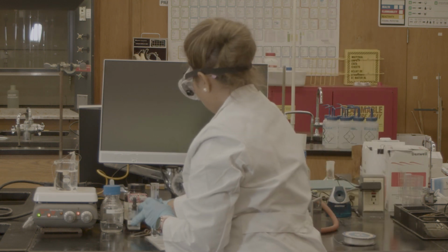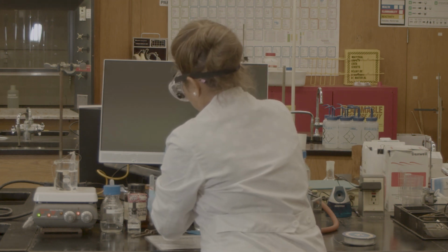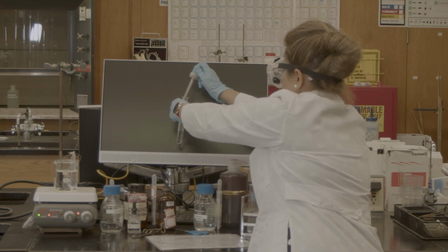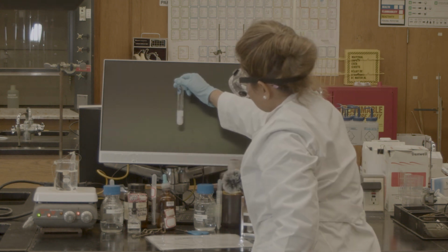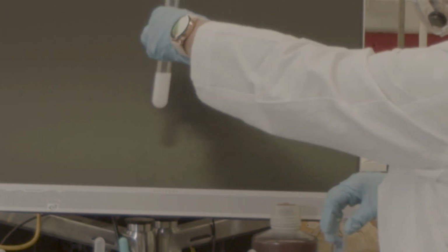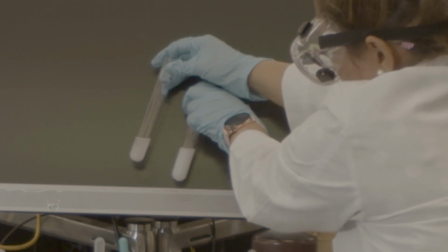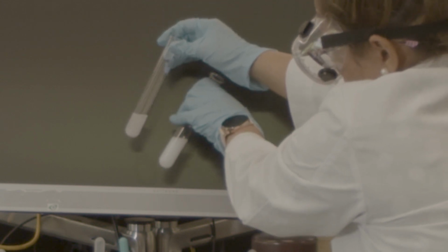The second one for chloride ion, I'm going to use silver nitrate. One, two, three, four, five. So you can see there is a white. It was clear, now it's white. So I have chloride. This is my after dialysis result, and this one is my true or standard result. So you can see. Okay. So true, and this is for after the dialysis. Standard result and after dialysis.